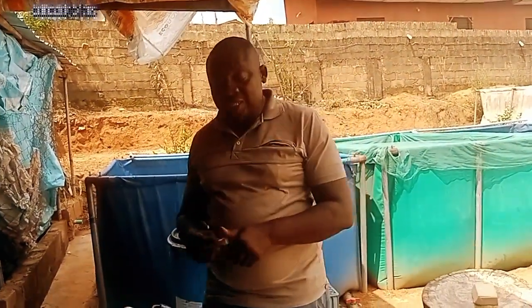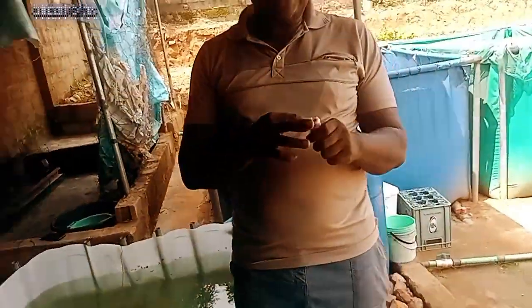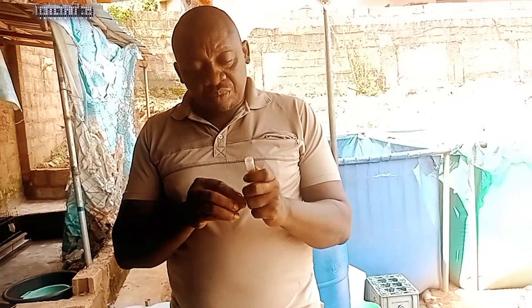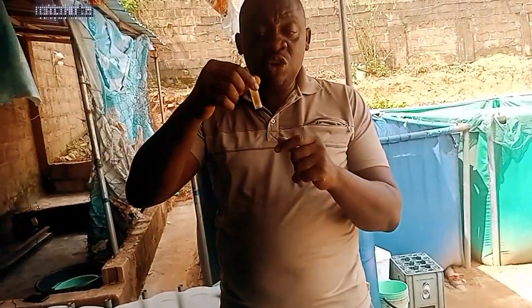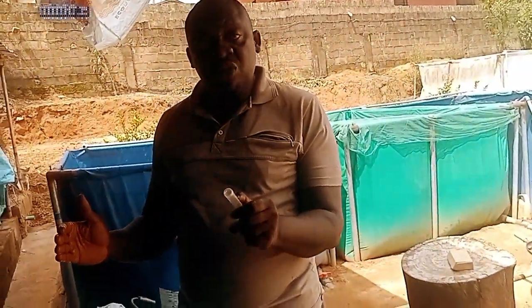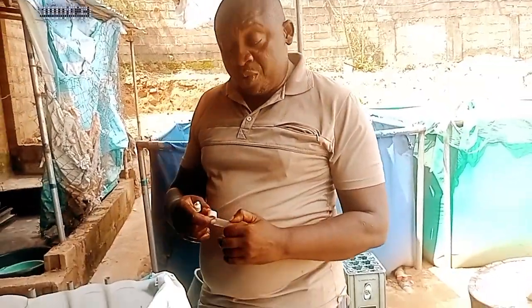If the water changes to acidity, the checker will tell you the water has already changed to acidity. If the water changes to alkalinity, the checker will tell you that the water has changed to alkalinity. That is the purpose of the checker, and that is what we are using the checker for today: to control the CO2 of your water. So it changes to green, and in there you have the greenish color. It purposely controls your water. It controls the pH, that means the potential hydrogen of your water. That's the purpose of the checker.